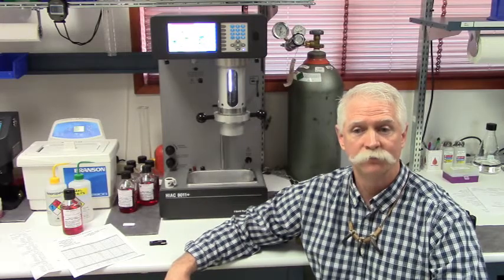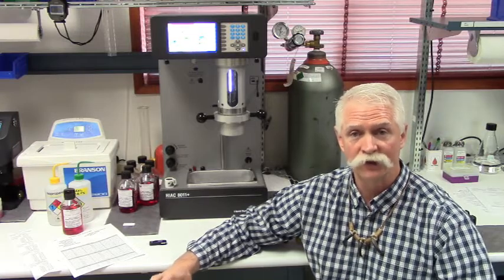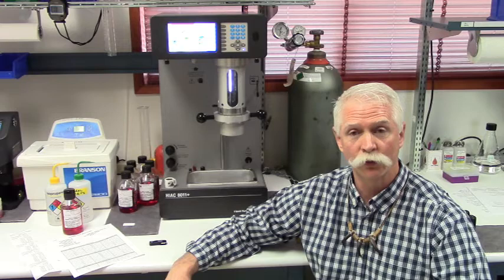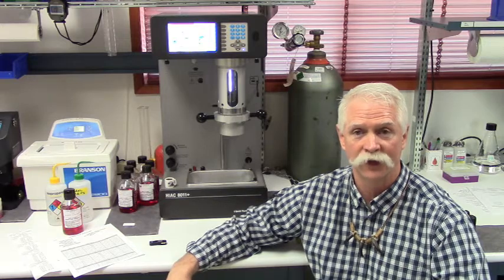For instance, number one, first thing you want to do when you do any kind of demo is you're going to set the thing up at home, including the compressor, all the tubing, fully functional to make sure that this instrument is good to go. You're also going to run a sample at home. We want to make sure this thing is fully functional and you're comfortable with it before you ever step foot on the customer's site.